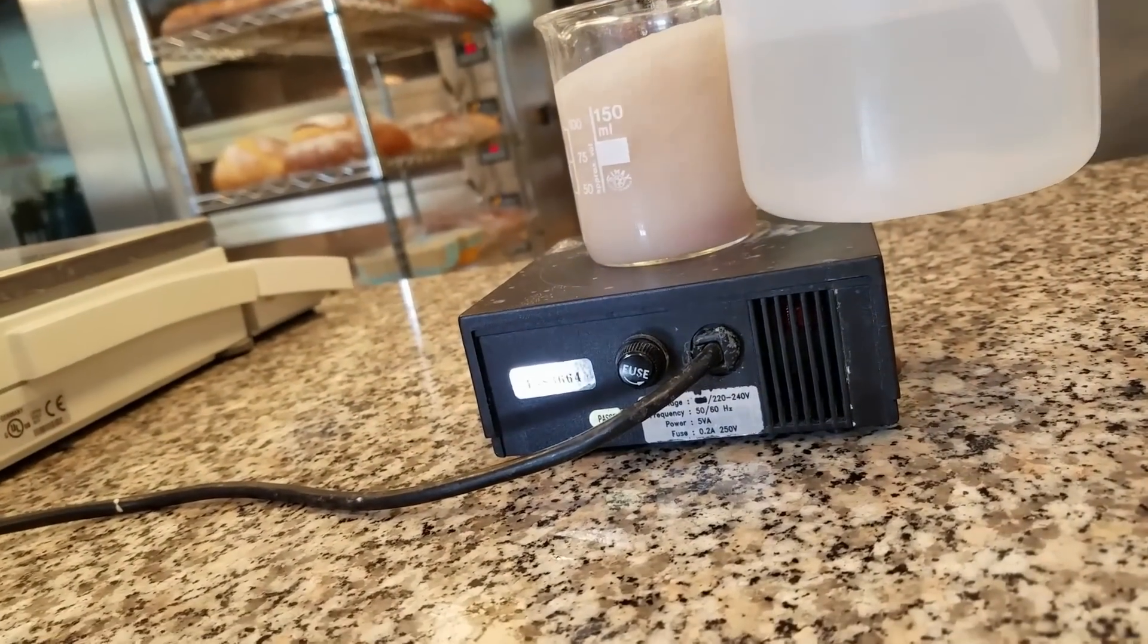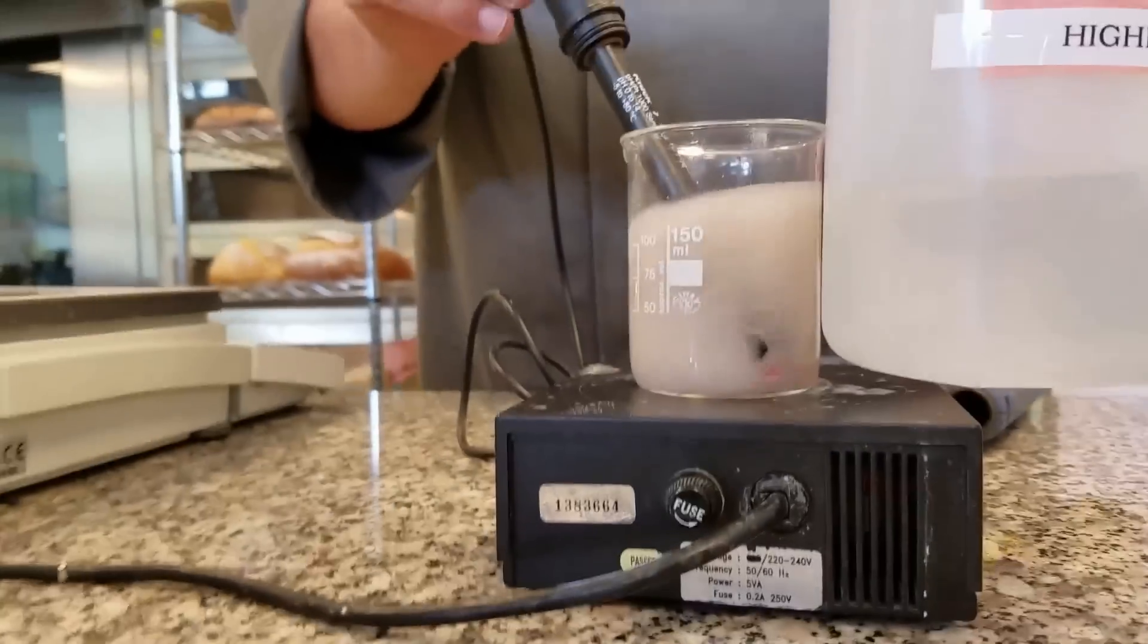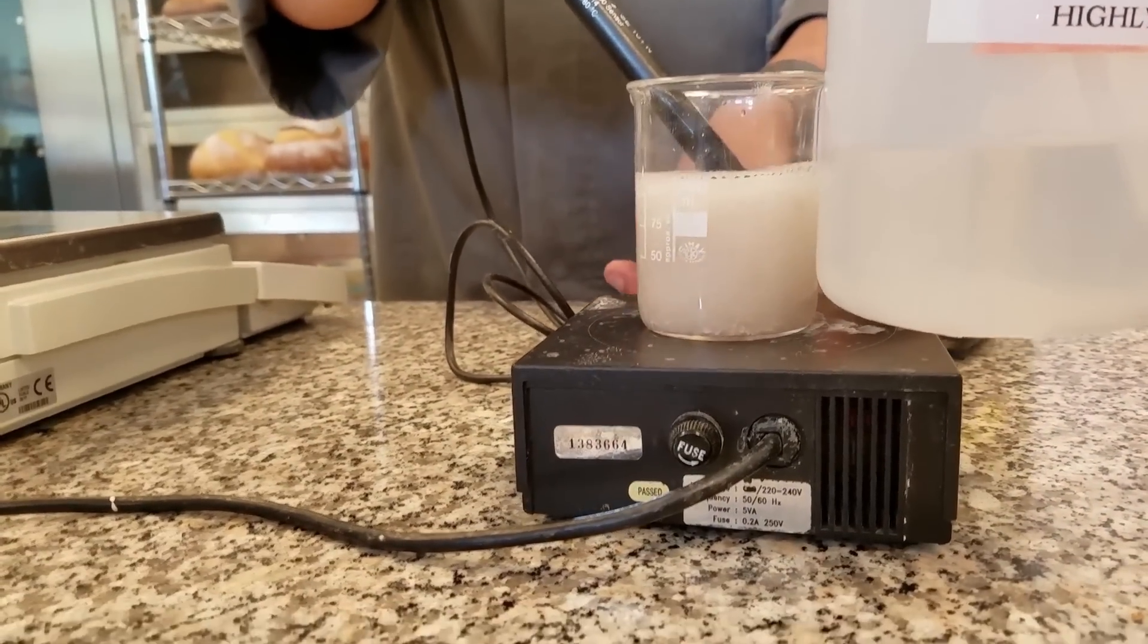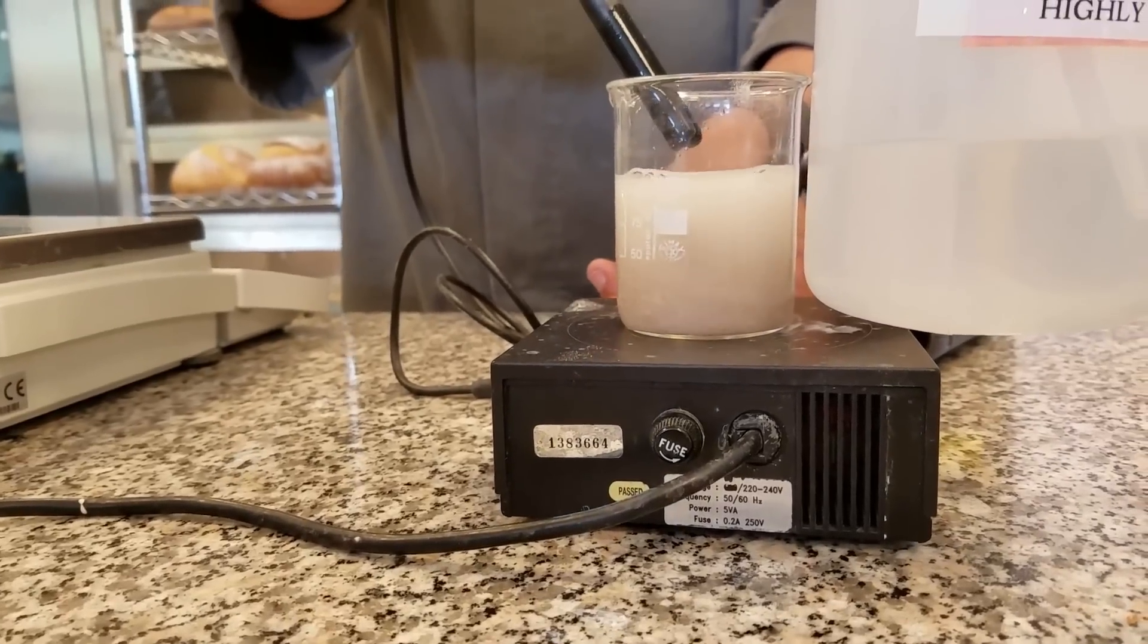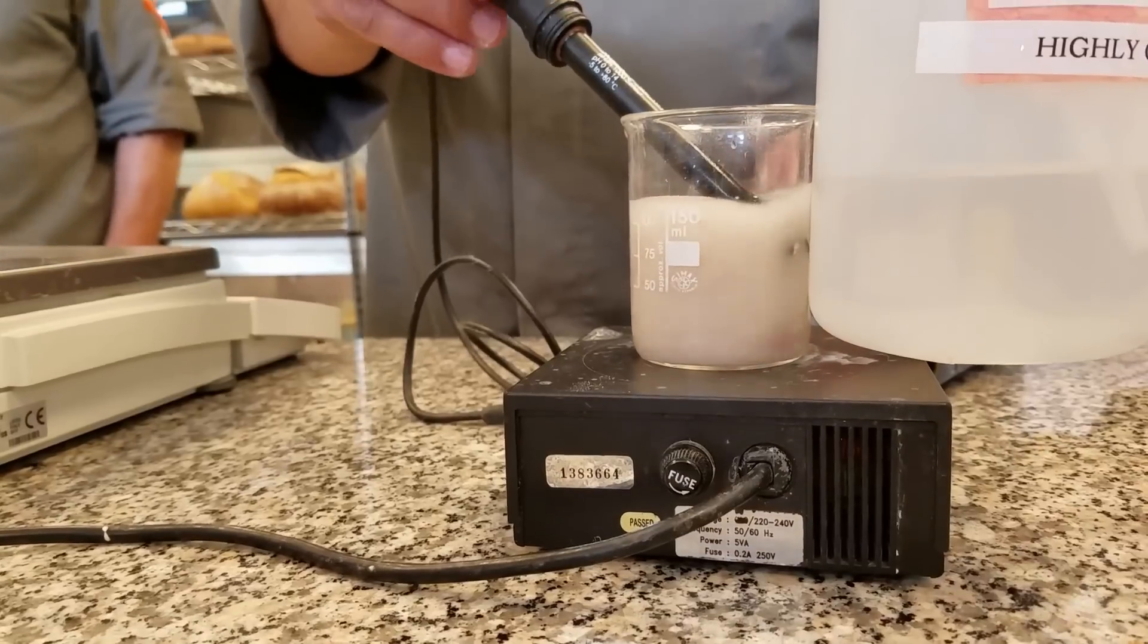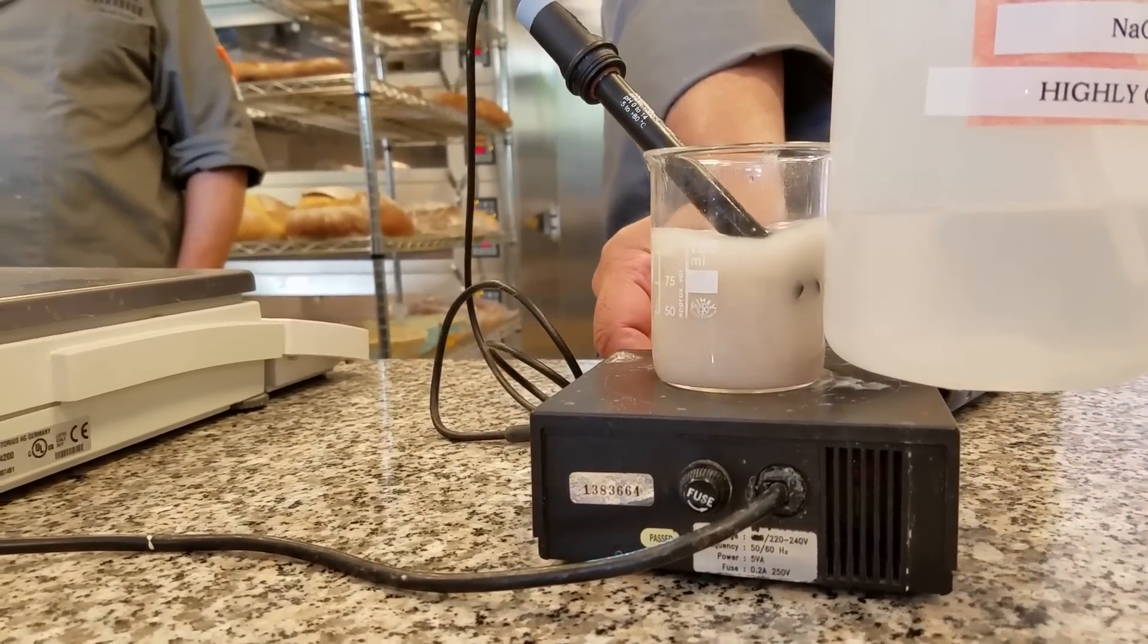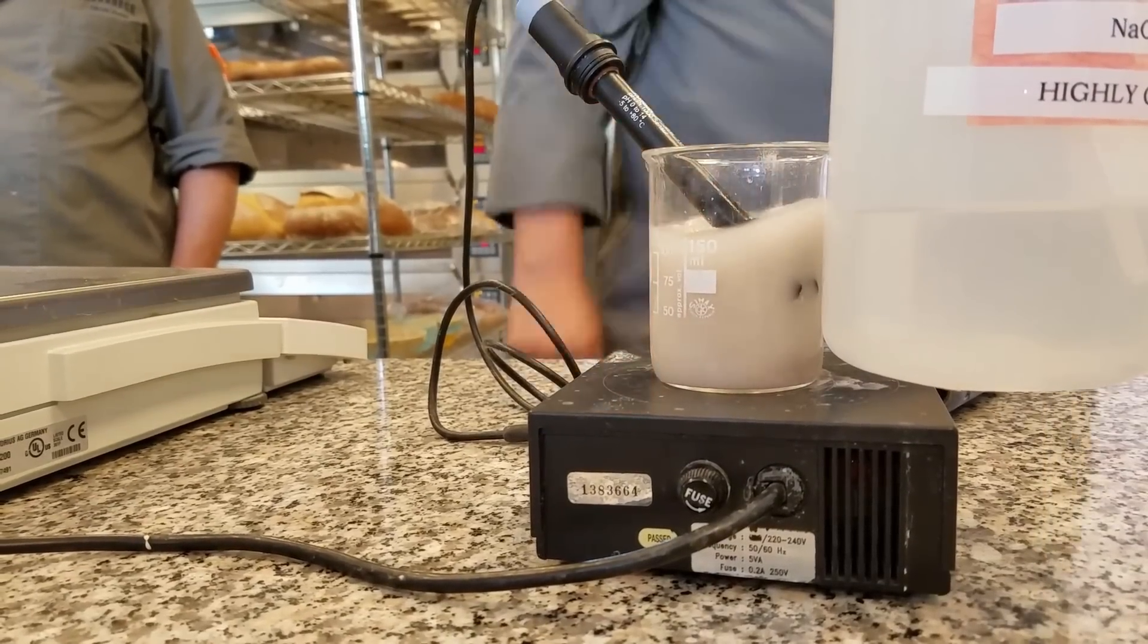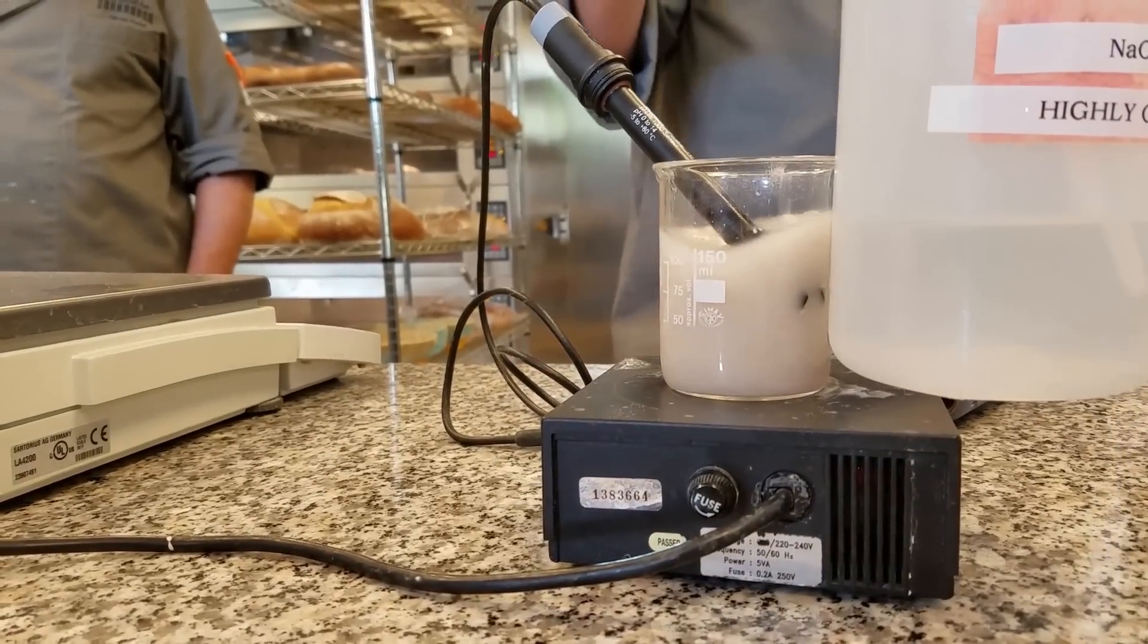And now I'm going to measure the pH. So pH is around 4.05.